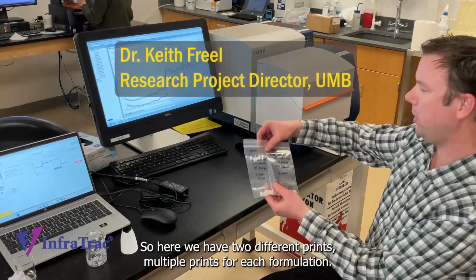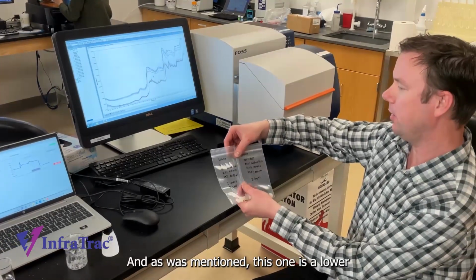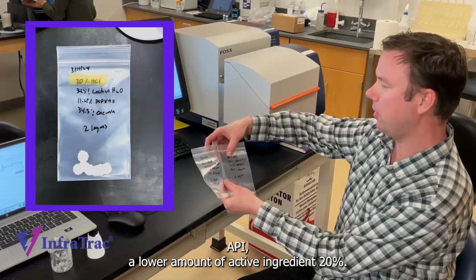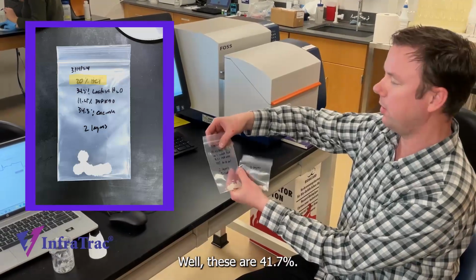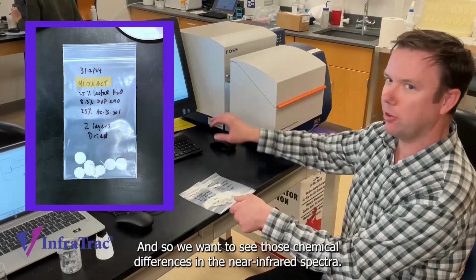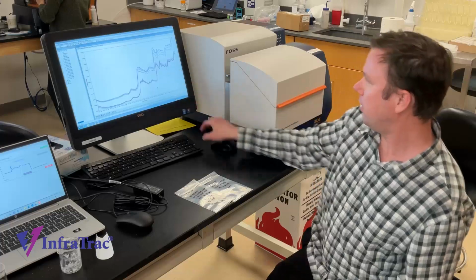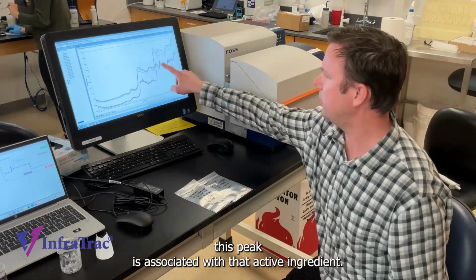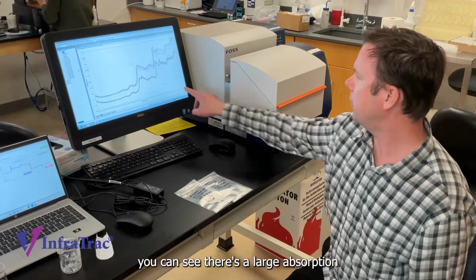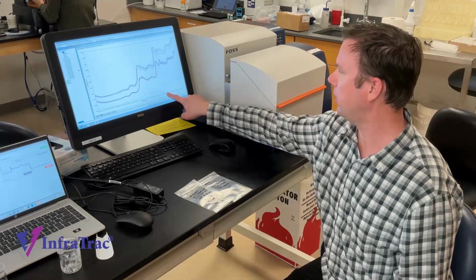Sure. So here we have two different prints, multiple prints for each formulation. And as was mentioned, this one is a lower API, a lower amount of active ingredient, 20%, while these are 41.7%. And so we want to see those chemical differences in the near infrared spectra. And if you look here, you can see this peak is associated with that active ingredient. And if I bring that up, you can see there's a large absorption of that active ingredient at this wavelength.